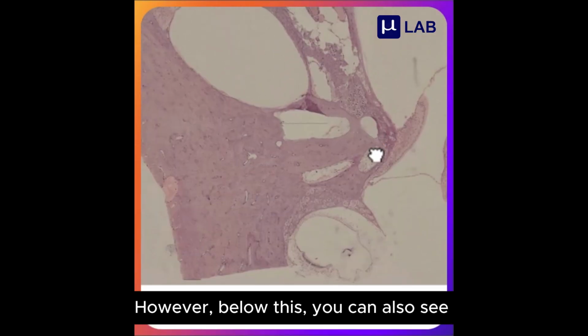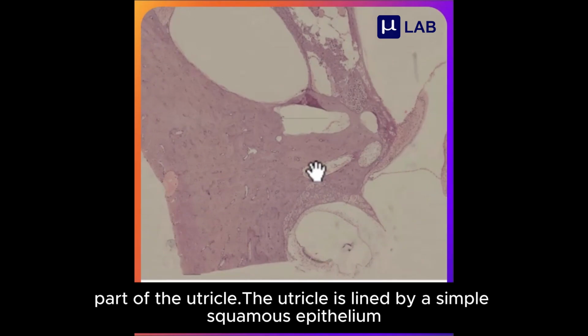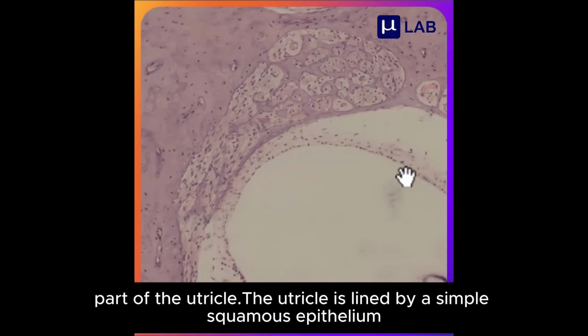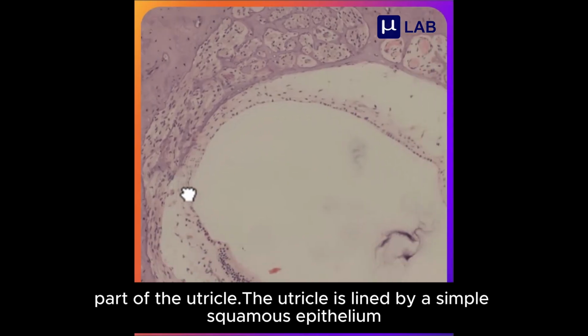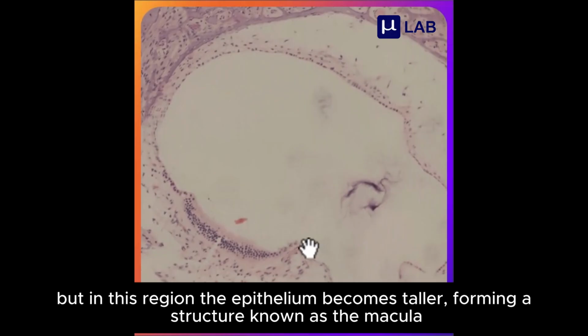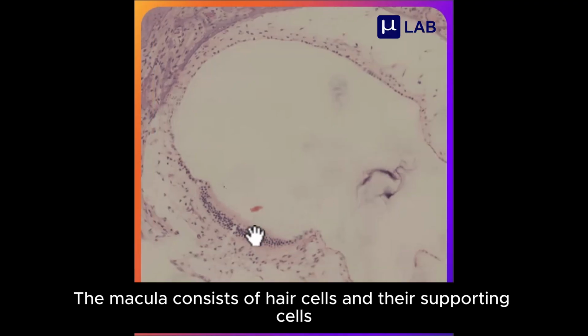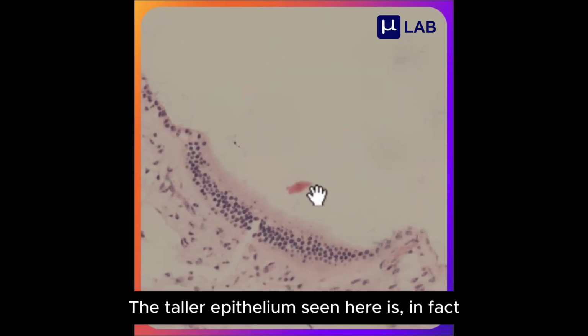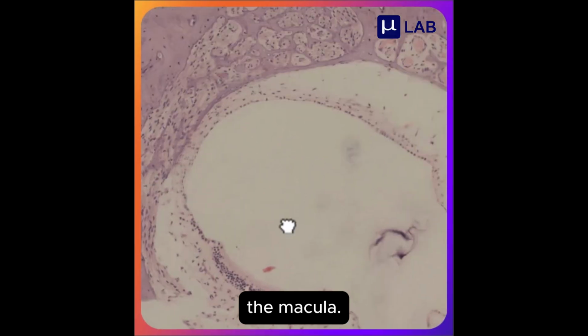However, below this, you can also see part of the utricle. The utricle is lined by a simple squamous epithelium. But in this region, the epithelium becomes taller, forming a structure known as the macula. The macula consists of hair cells and their supporting cells. The taller epithelium seen here is, in fact, the macula.